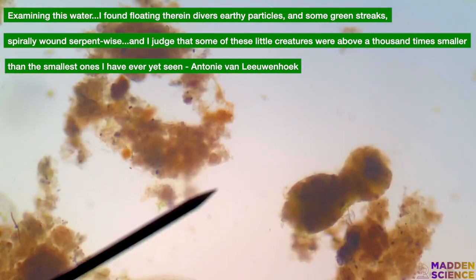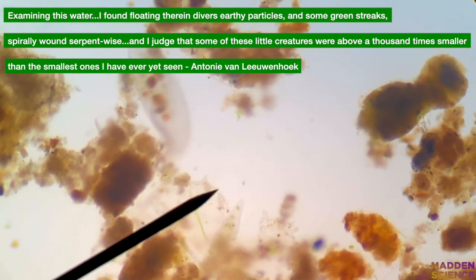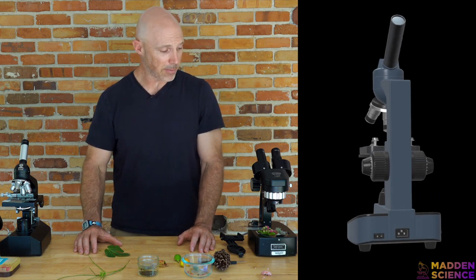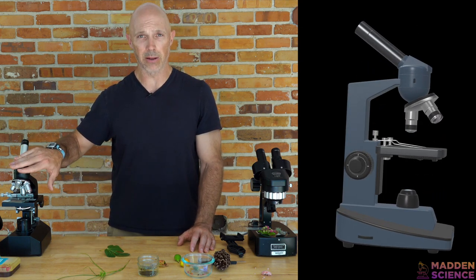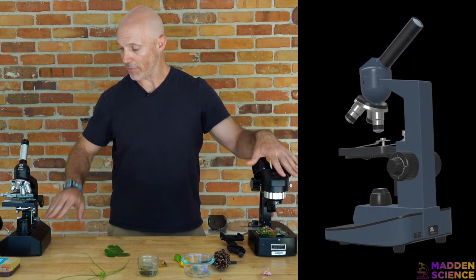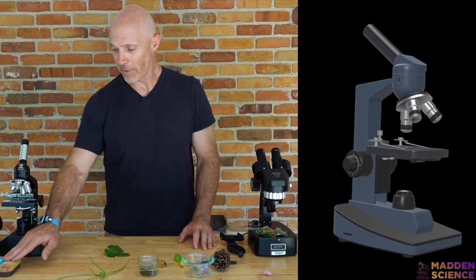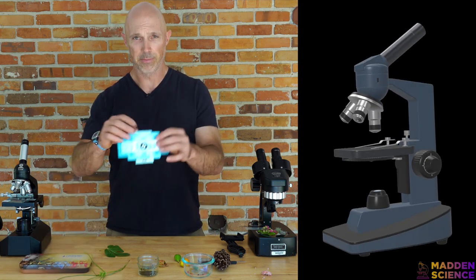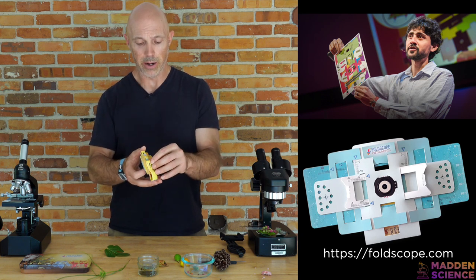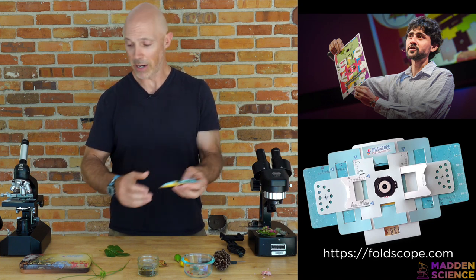Following the Scavenger Phase, we'll move into the Microscope Mania Phase. Take a look at some of the materials you'll need for this lab. You're going to need some microscopes — we've got a regular compound light microscope, a binocular dissecting scope. You can see these have their own light sources, although they could be used out in the field potentially. I've also got a foldscope — a really cool option you might have in your classroom or could buy. It's basically made out of paper: small, portable, field-ready, and cheap.